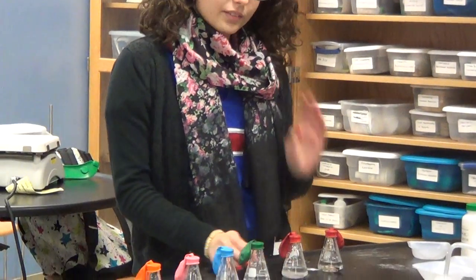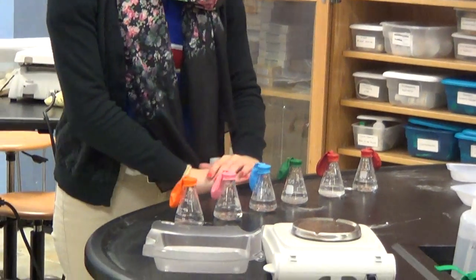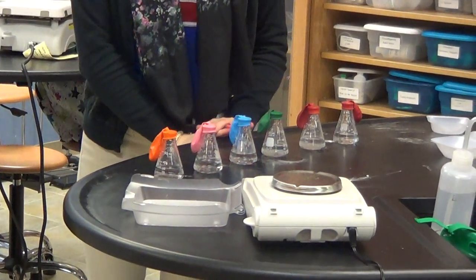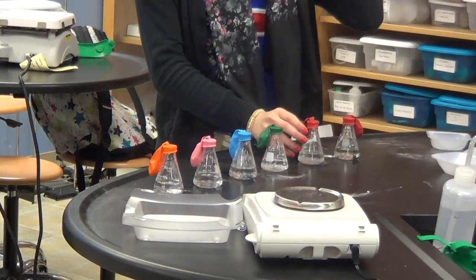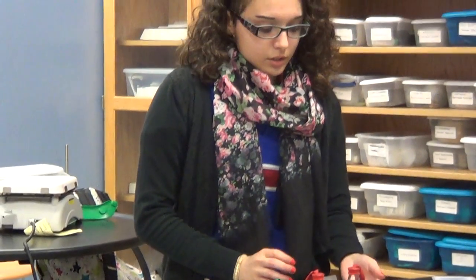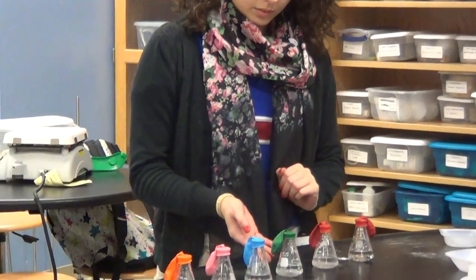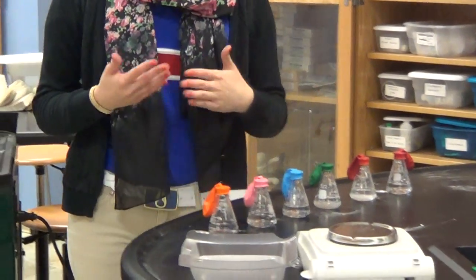I'm using a flask, and each flask has 25 milliliters of acidic solution. Each balloon contains a different amount of sodium bicarbonate — 0.5g, 1.5g, and so on — increasing in increments of 0.5g. Each one is supposed to produce an increase in carbon dioxide.